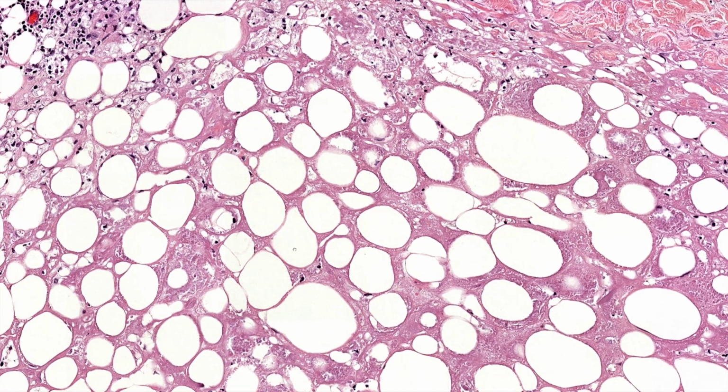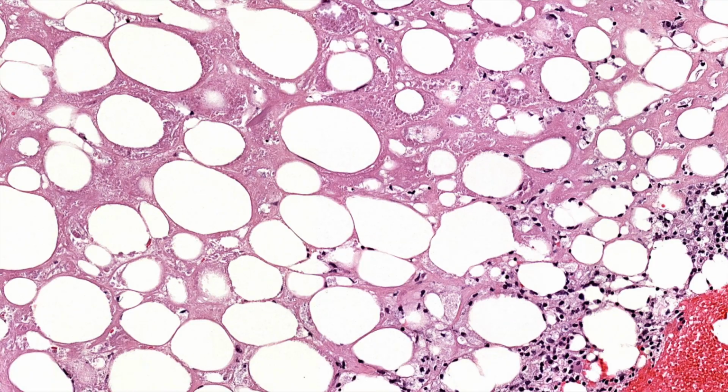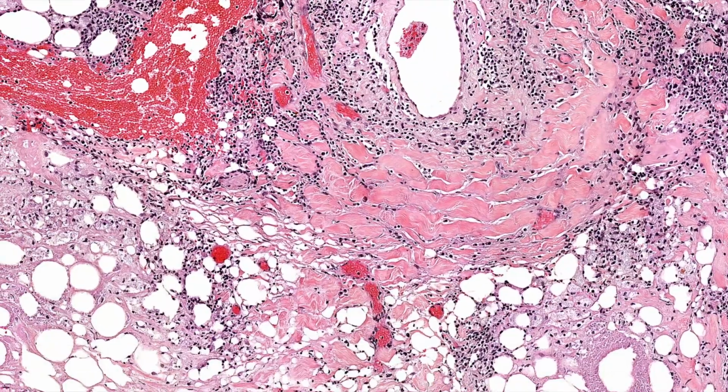And in addition to them being dead, like you said, they're hyalinized, right? They have this weird mixture of dense fibrin slash necrosis, fibrinoid necrosis, filling the spaces in between the dead adipocytes. And then additionally, you often begin to get really dense sclerosis of collagen. And like you said, it gives it that firm, squared off sign that makes it look like a sharp square or rectangle shape. That makes you think a little of morphea, right?